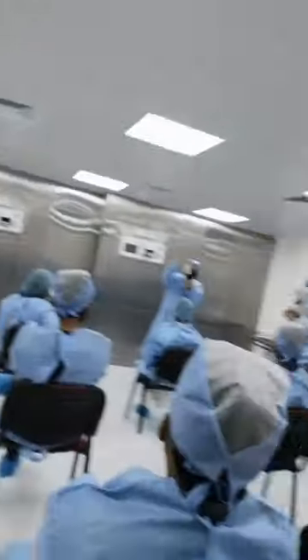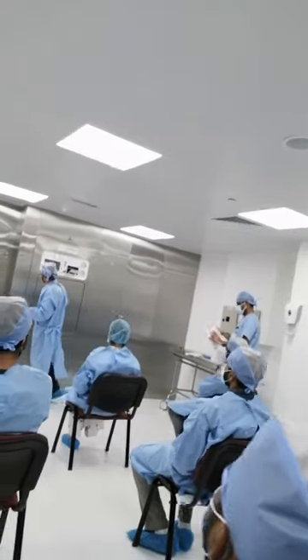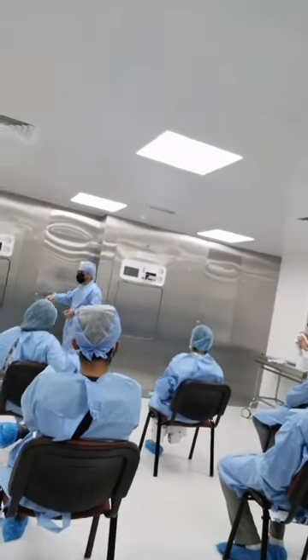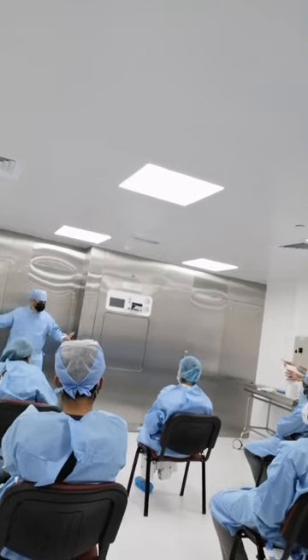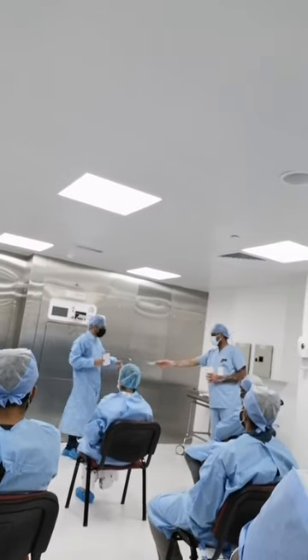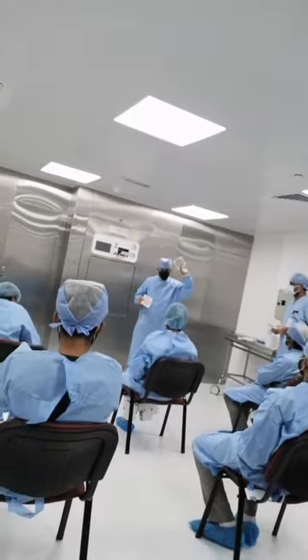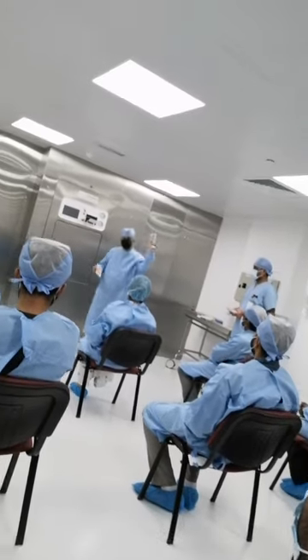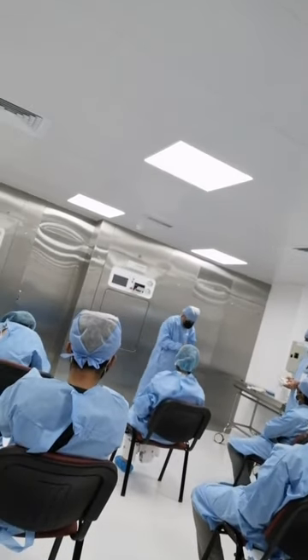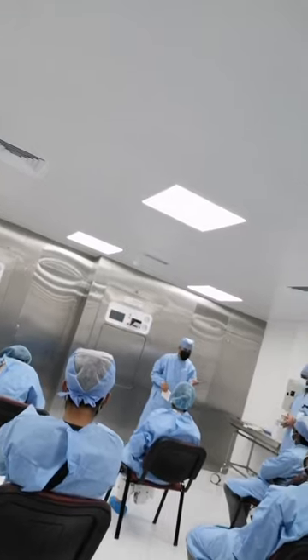It doesn't matter at all. Don't compare paper to paper. Don't say that this machine's black color is more black than this one — that's not valid. I just see this paper in my hand. I don't compare it to any other black. Only the color which is here.